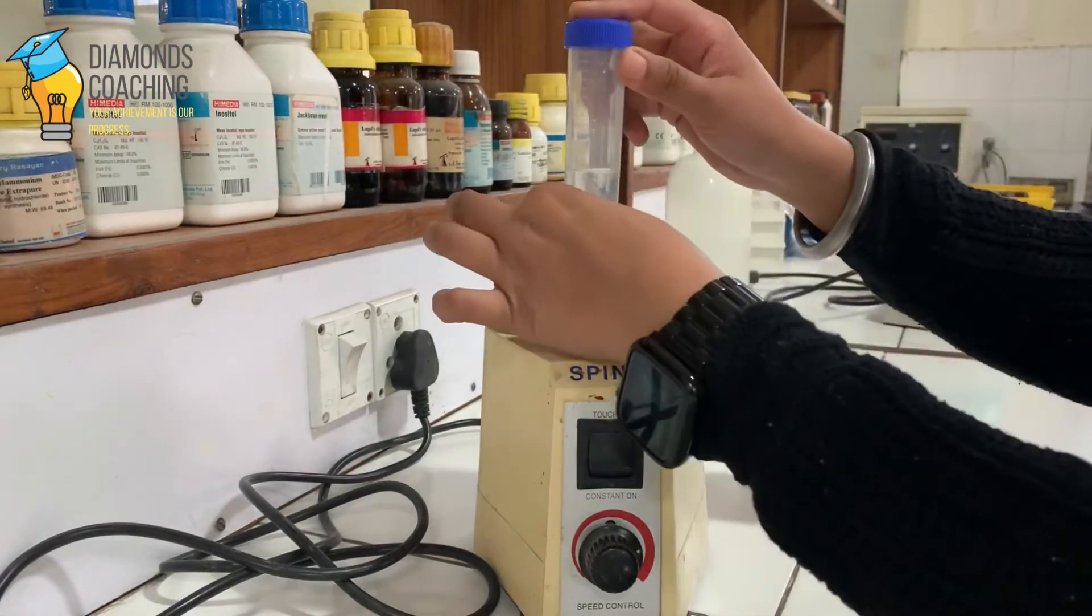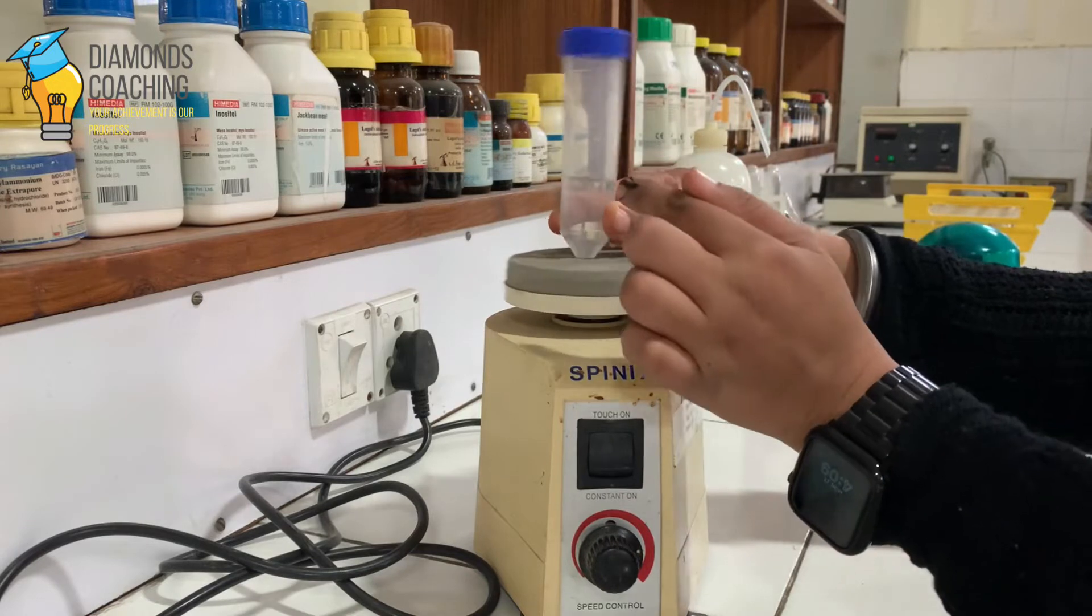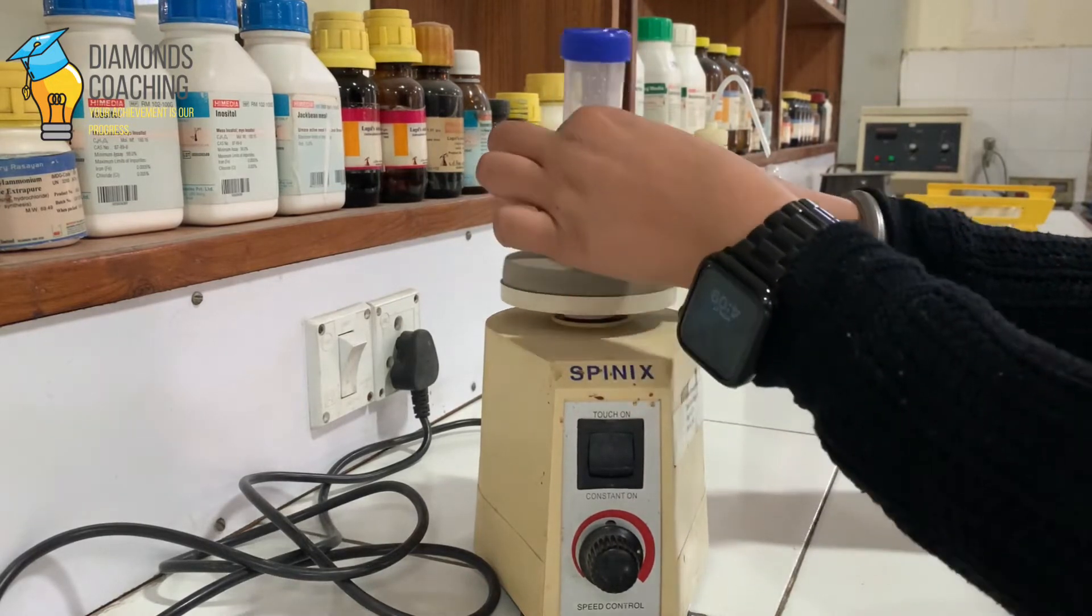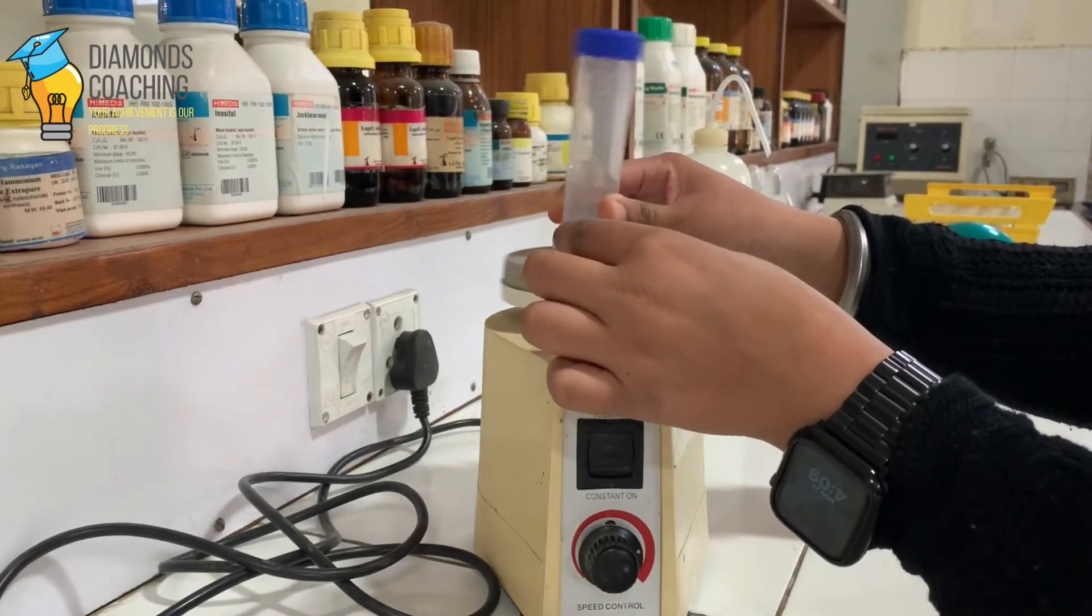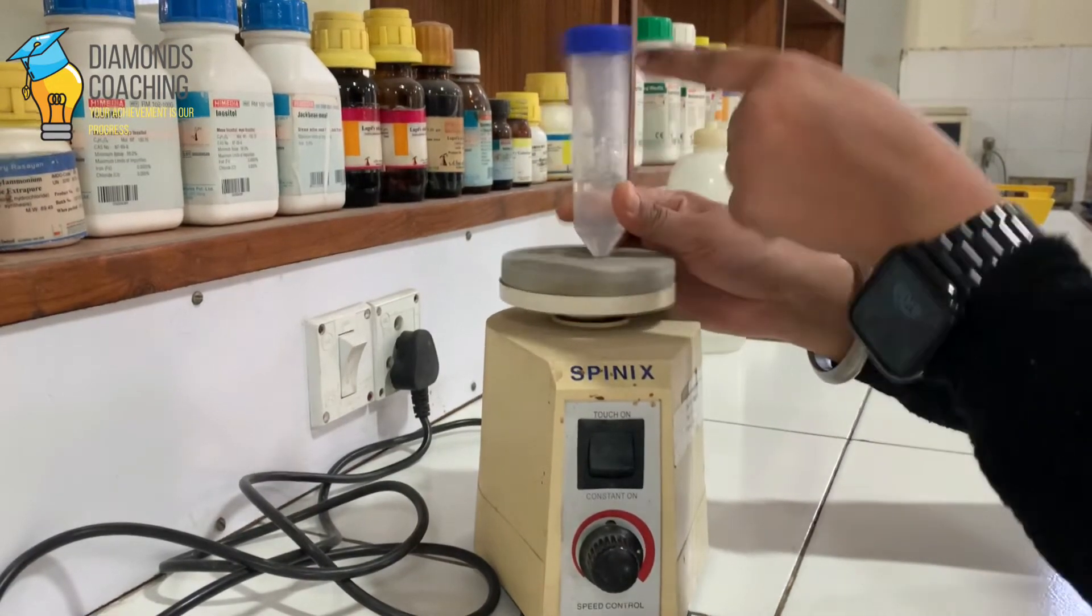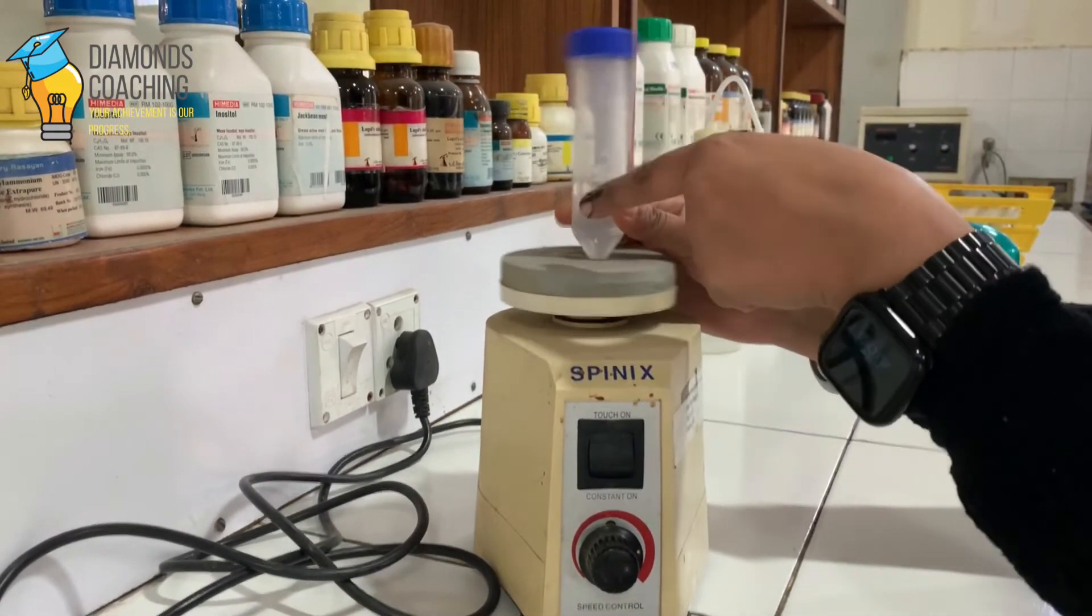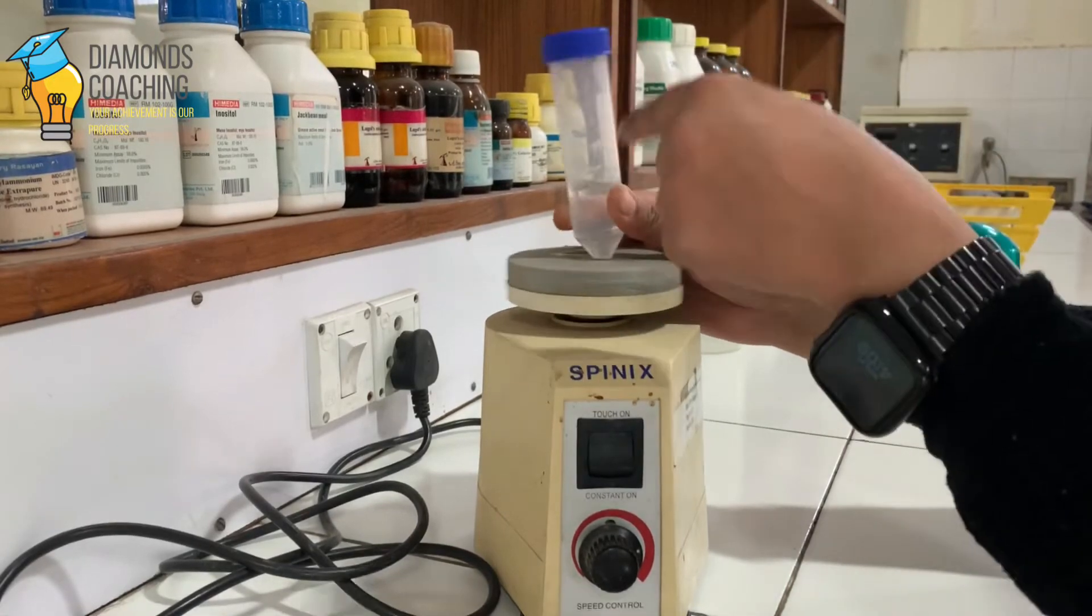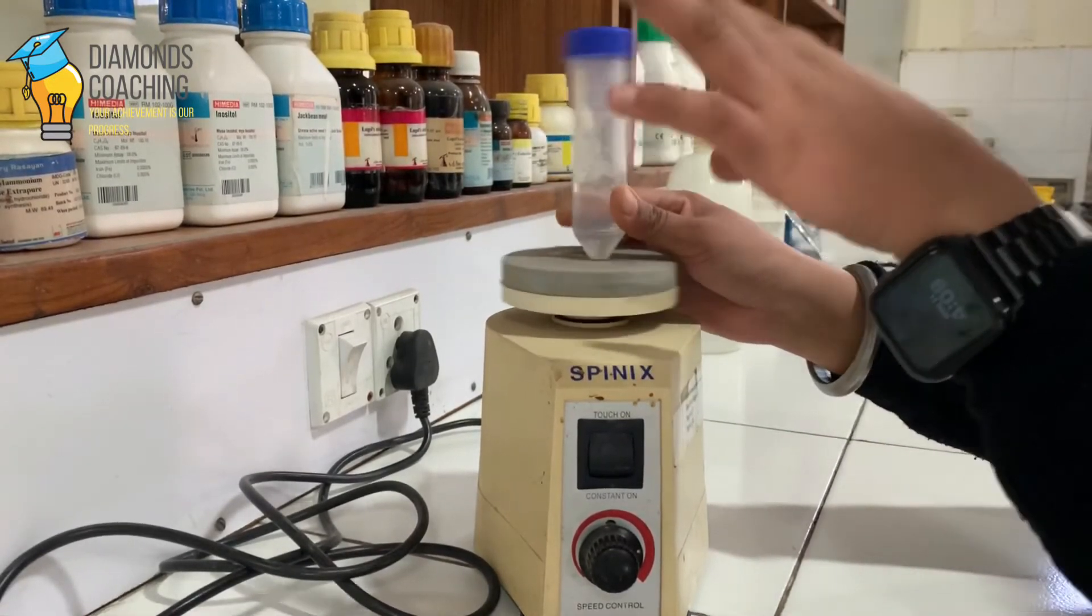But if I hold this from the lower side, like this... yeah, and if I hold this from lower side, it doesn't touch the cap, it doesn't raise up. So these are the two methods how we can hold the vial on this surface.